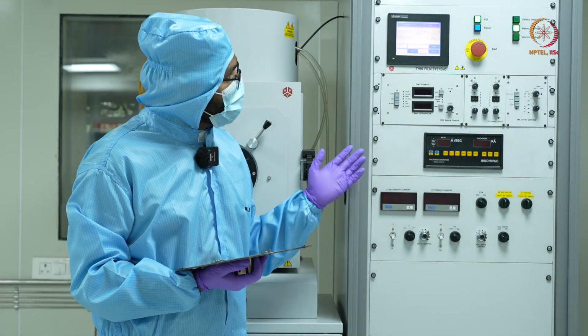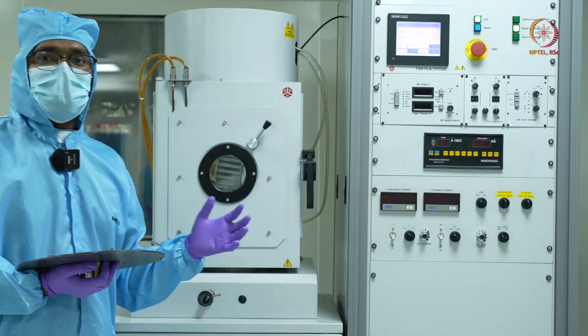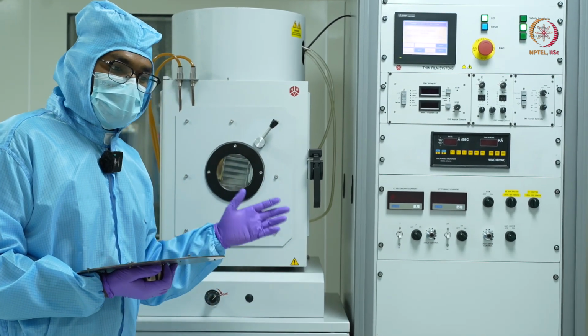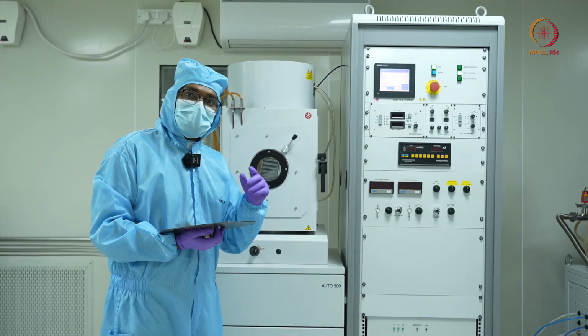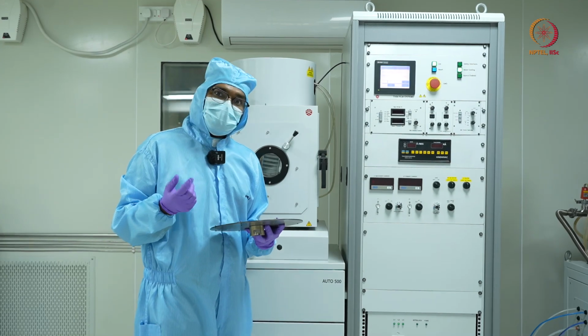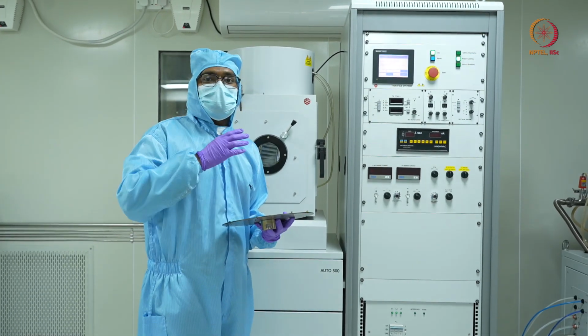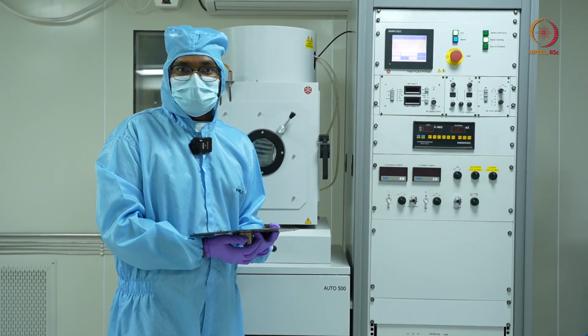And now you can see the pump started running, and there is a noise. There is this noise because of this evacuation, which will die down eventually. A fun fact is that this noise dies down because the chamber is going into vacuum, and in vacuum sound waves cannot travel very well.